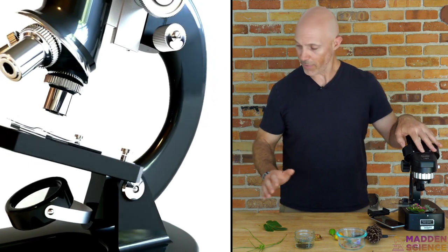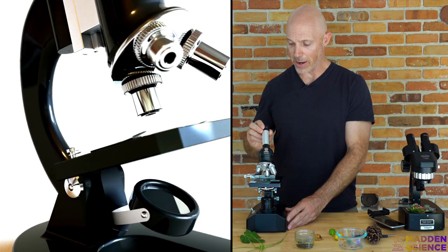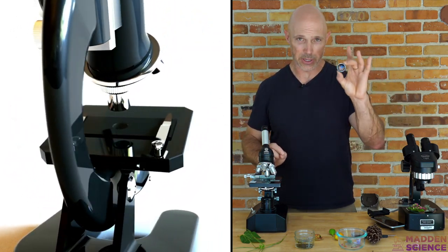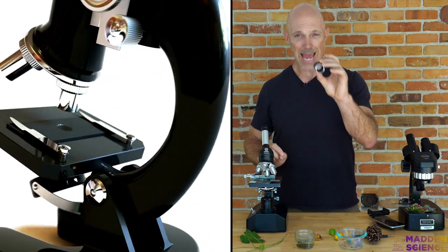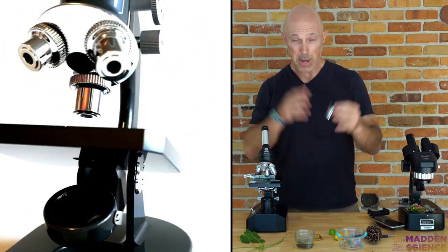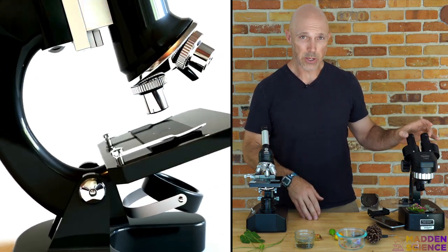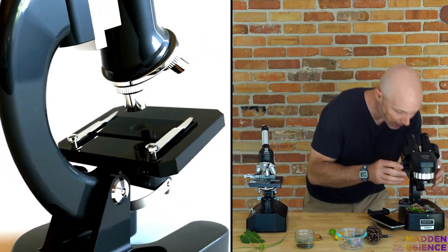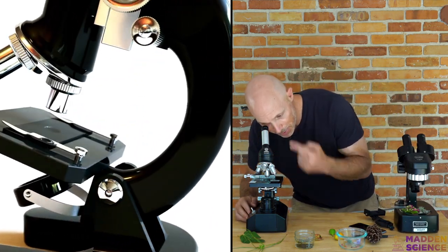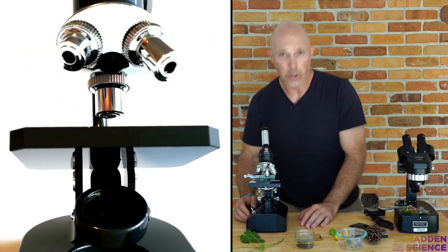So here's what you've got. If we take a look closely at a compound light microscope, we've got our eye or ocular lens. In some microscopes, you'll see that this actually comes out. These are almost always 10x, meaning it multiplies what you're looking at by 10 — or makes it 10 times bigger. This one has two of them so you can look with both eyes at the same time. You want to practice keeping both eyes open to avoid eye strain, although you could do it with just one eye open.